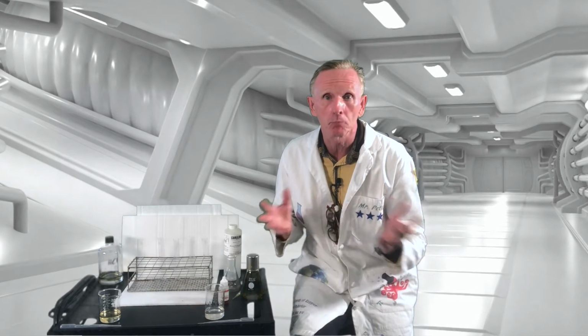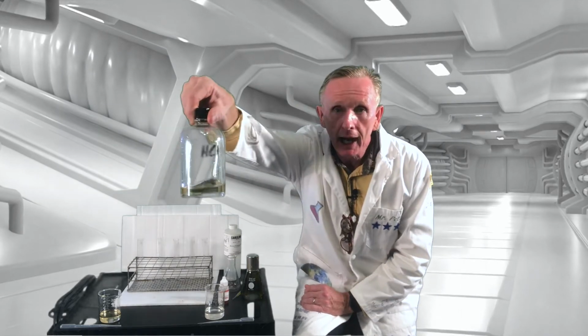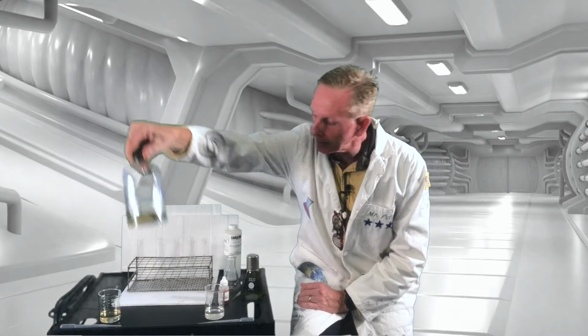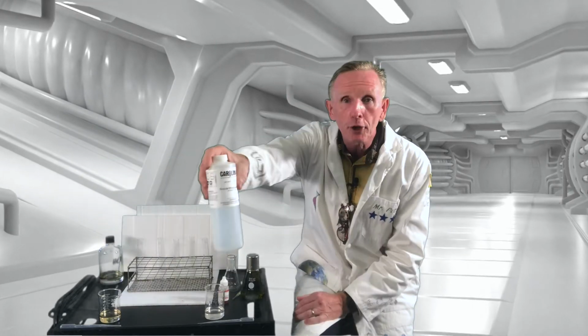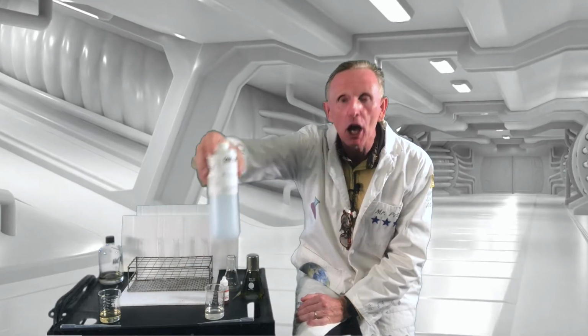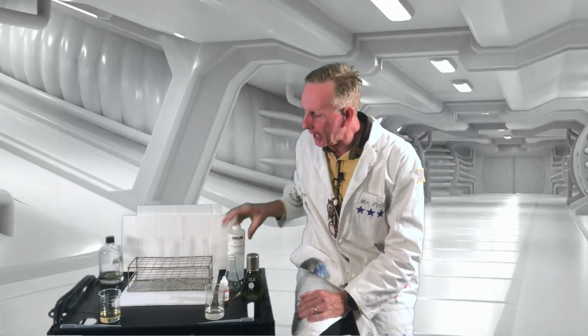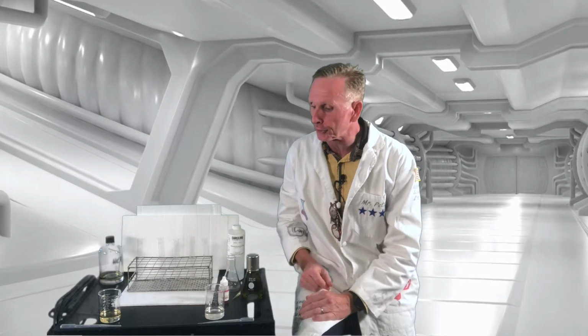If we're dealing with hazardous waste, it's not unusual for them to be a strong acid, strong base, something of this nature, and what happens when one runs into the other. In this case today, we are working with materials: hydrochloric acid, HCl, and sodium hydroxide, NaOH. They both can be very strong acids, very strong bases.